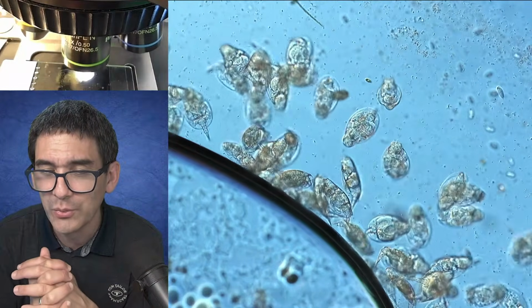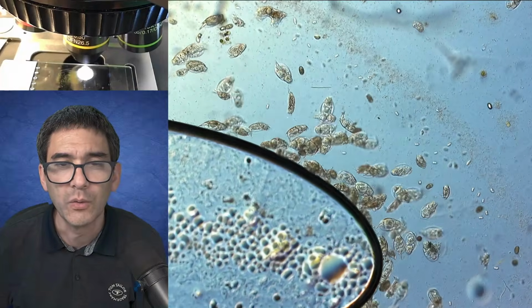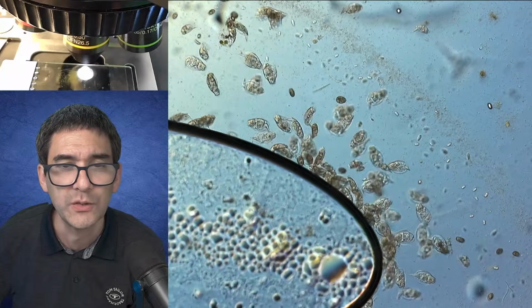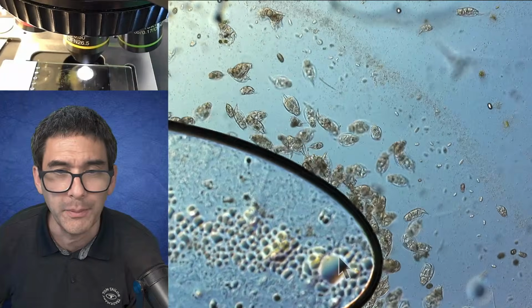Could you briefly recap who's eating who in such a sample? Well, I can. Very briefly. Let's go down with the magnification to get a better overview here. What we're able to see is the following. Let's explain not only who is eating who, but what's actually going on here. So what do you have over here? This here is an air bubble because the slide is slowly drying up.